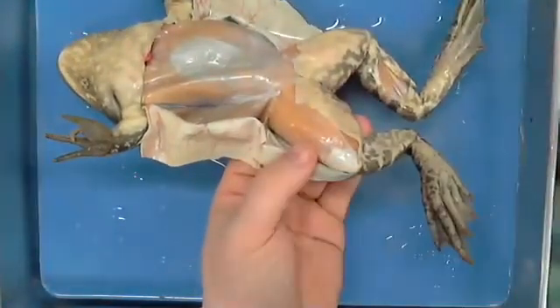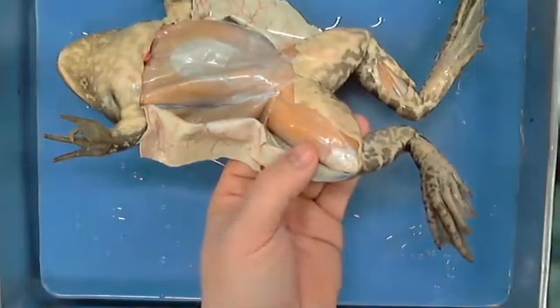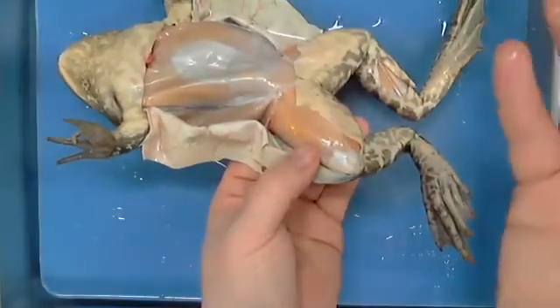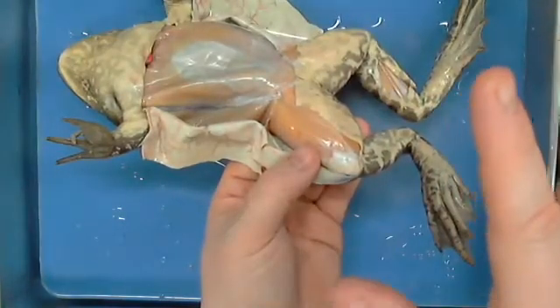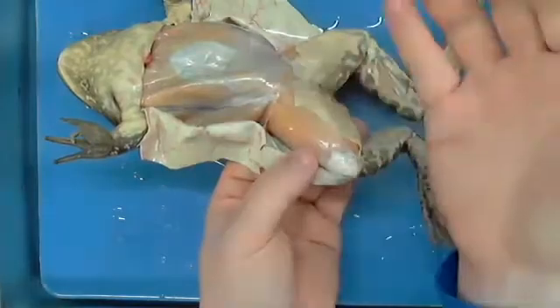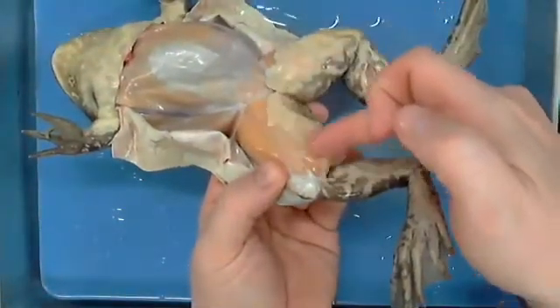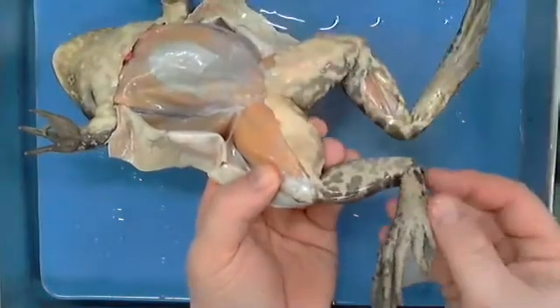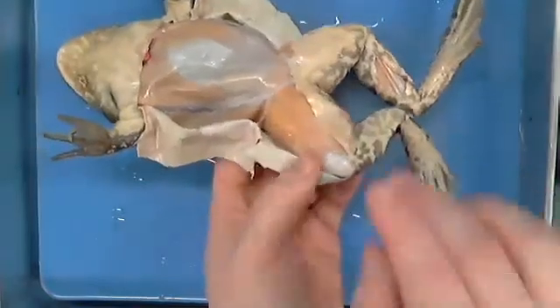There's a reason. No muscle pushes outwards. All muscles contract. That's the only thing they can do. They can relax and they will move back in place, but there's no force in doing that, okay? All of their force is in pulling. So as they pull, it pulls. Same thing for our flexor here. When we flex, it's attached to the inside part of this leg, and so it's pulling the leg together. So that's how all of that works.